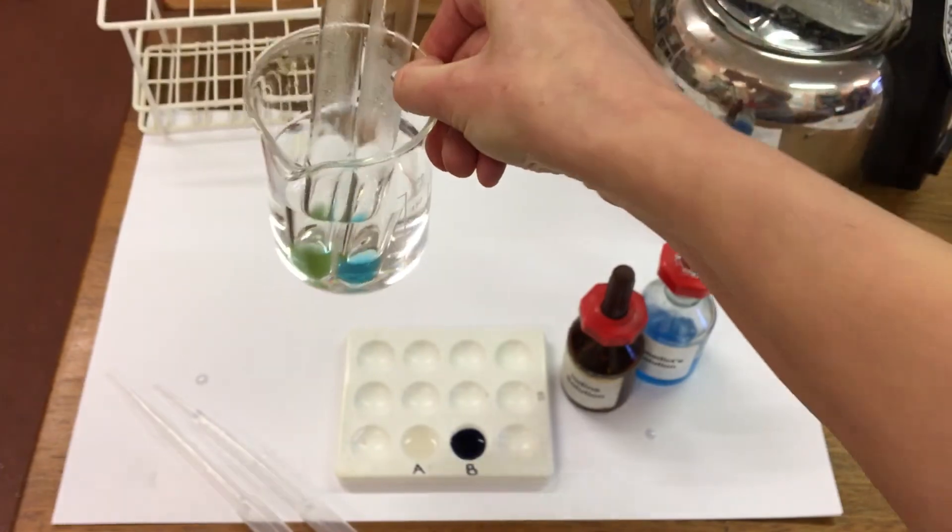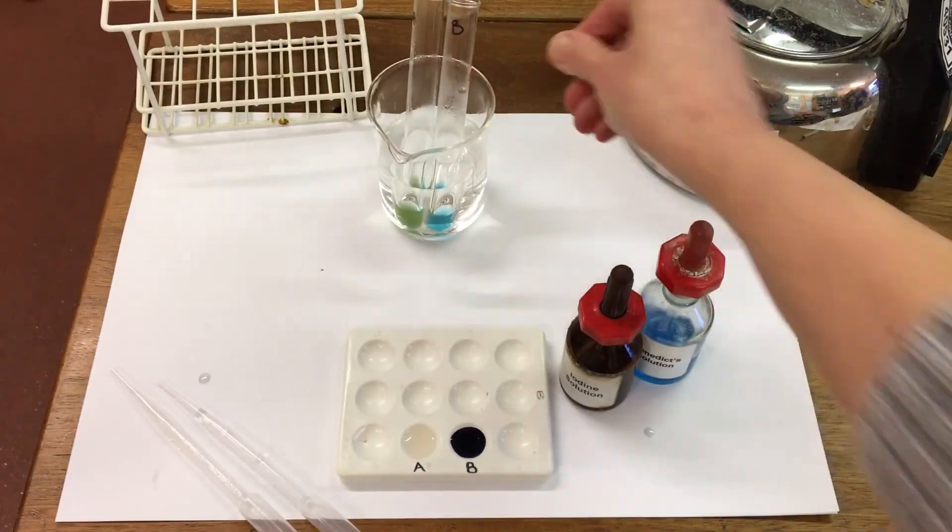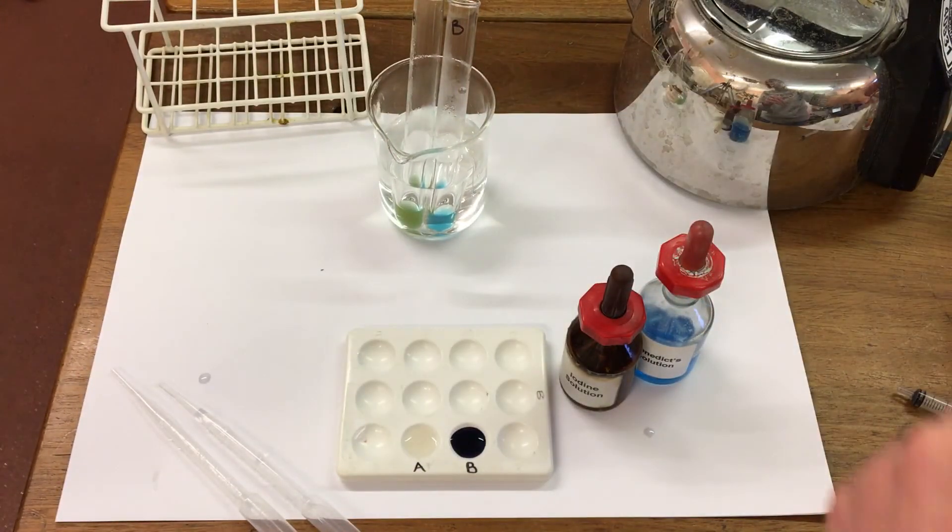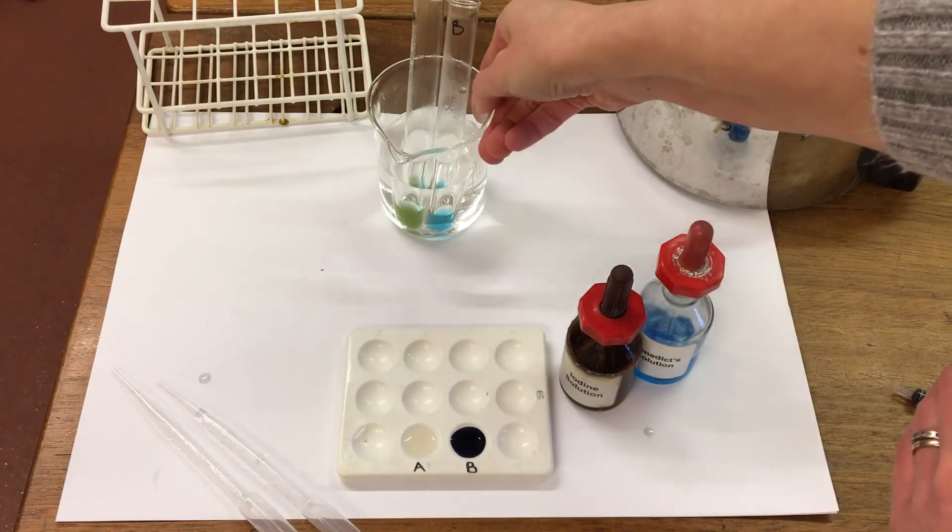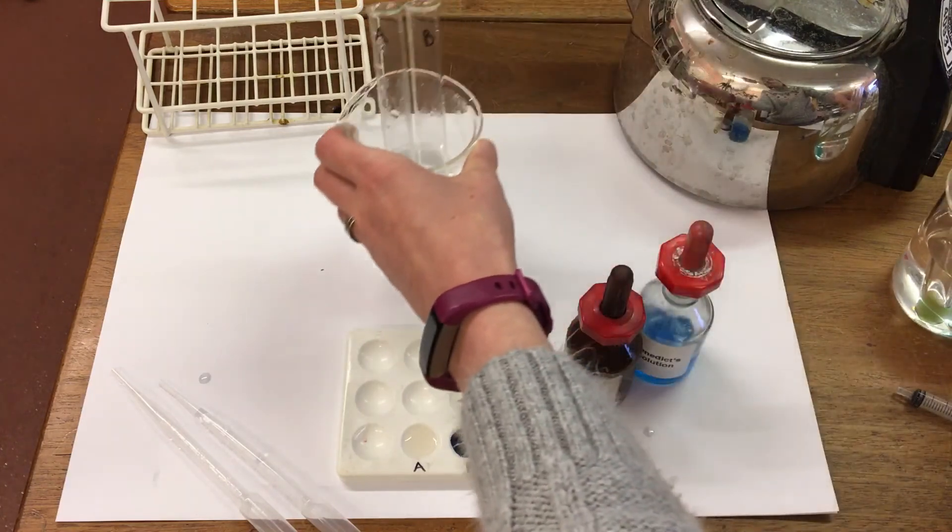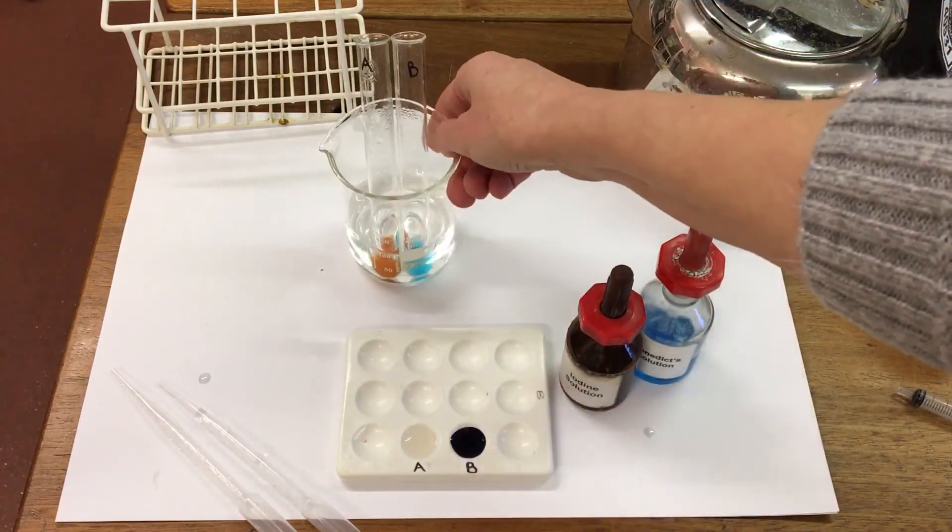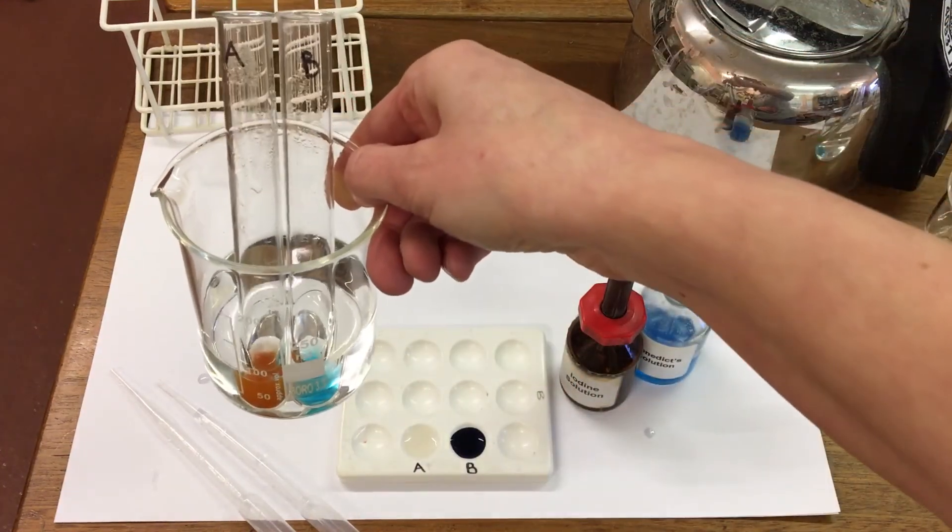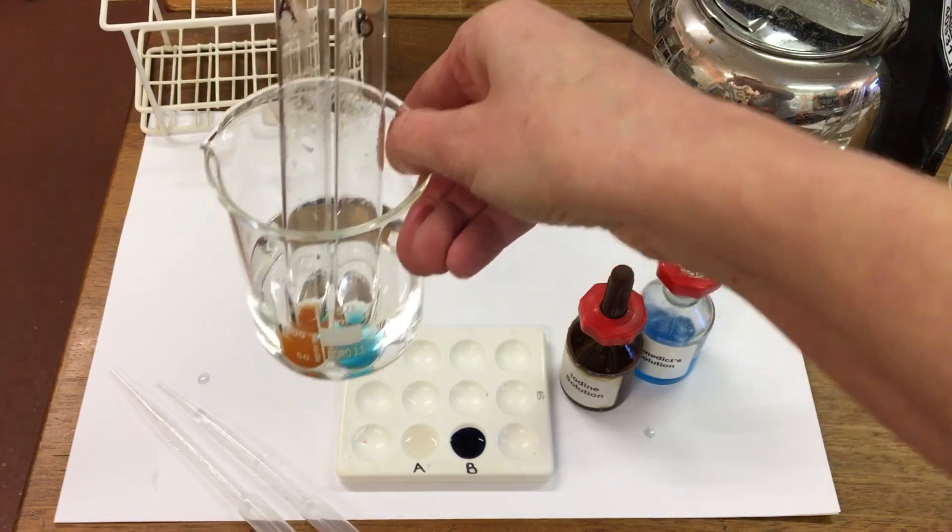And if we leave this for a full 10 minutes, we can see the color in A has gone brick red, but there's no color change in B.